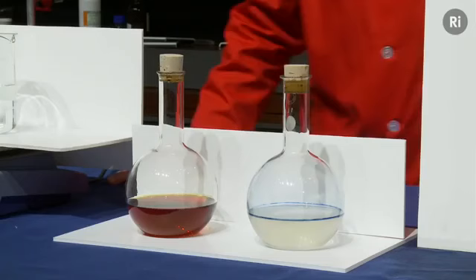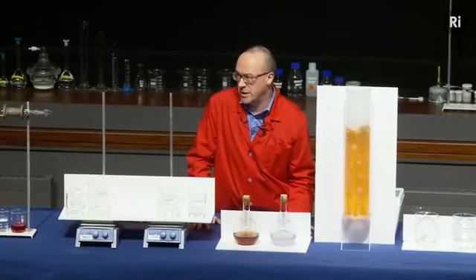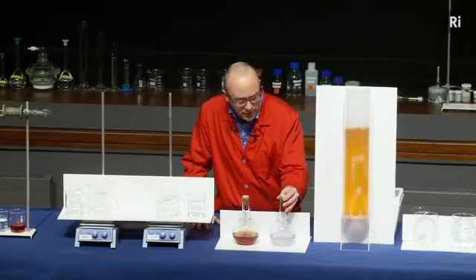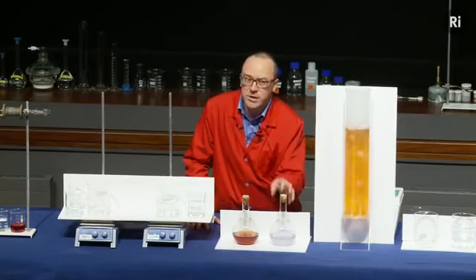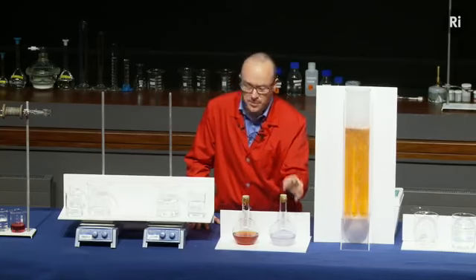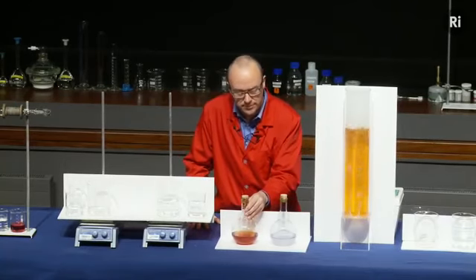So the next question is, did this chemical reaction then go backwards as it fades from blue to colourless? Is it a chemical reaction that's going backwards? Well, unfortunately, it isn't, because what's happening is there's a second chemical reaction taking place. This flask contains a dye called methylene blue, and when it reacts with oxygen, it goes from colourless to blue, but also in the flask is some glucose, and that glucose slowly turns the methylene blue from blue colour back to being colourless.